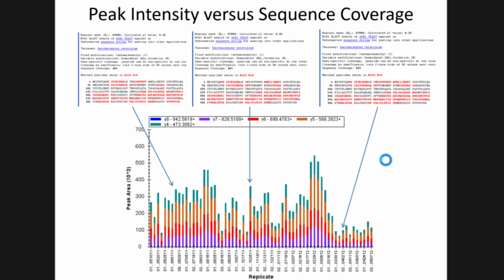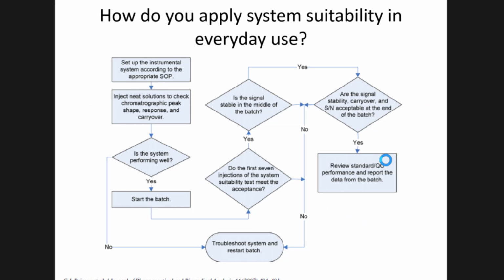Oh, we must be doing awesome if it's 49% sequence coverage, right? Kind of, but we're not, because the peak intensity is so low. What are we sacrificing? We're obviously not sacrificing sequence coverage for that protein, but clearly something is not quite right. So this is why looking at number of peptides or sequence coverage is not always the ideal and sole indicator of system performance.